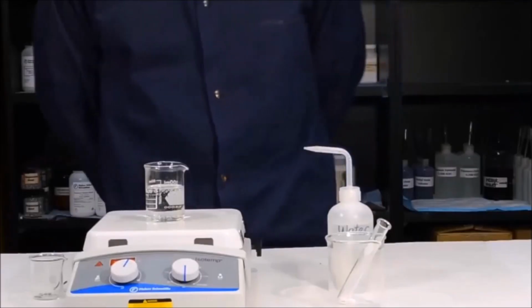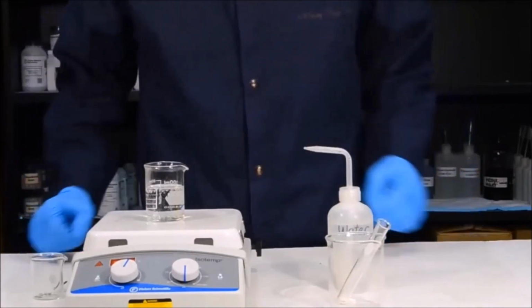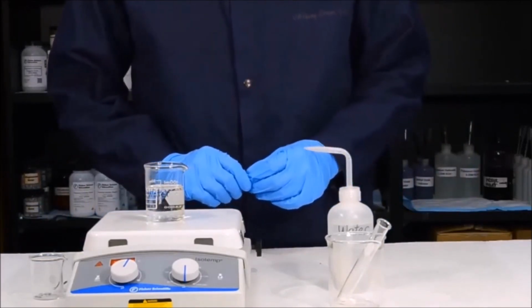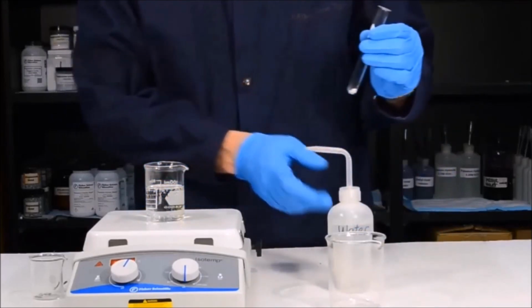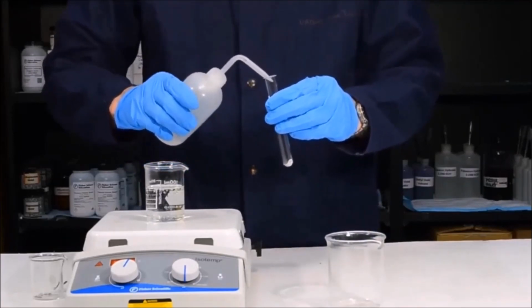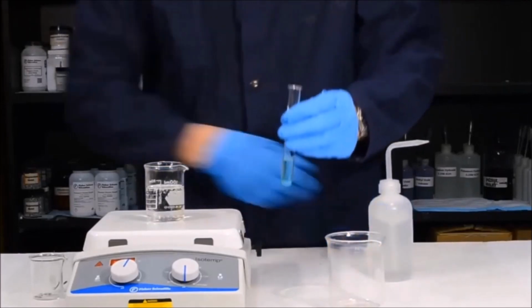Once you've dehydrated the copper 2 sulfate, it's now time to precipitate out the copper metal in a single replacement reaction. Before you can do that, we need to dissolve the copper 2 sulfate in water. It's very important that you have a cool test tube before you add water. If you add cold water to a hot test tube, it will crack the glass. So please ensure that the test tube is cold, and then simply add an inch or two of water to the bottom of the tube.